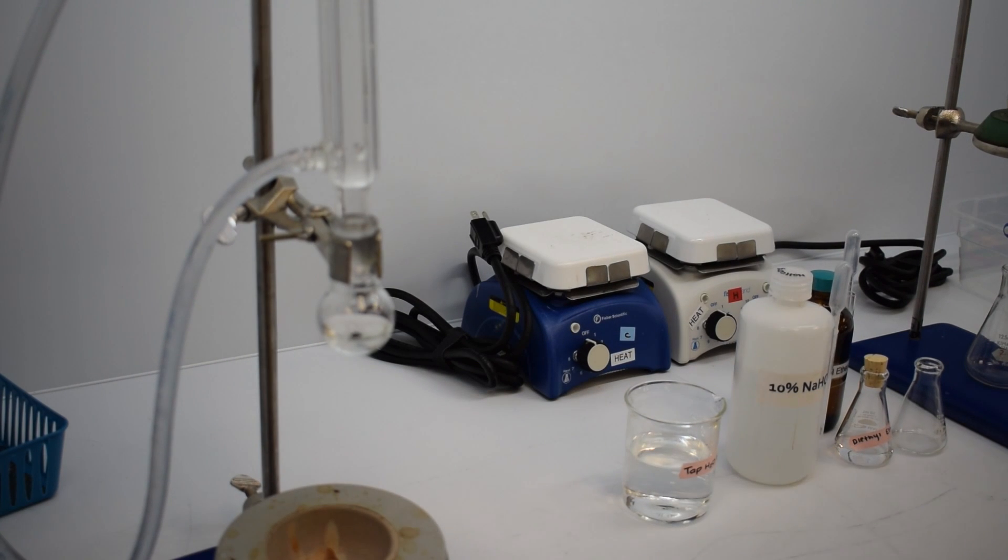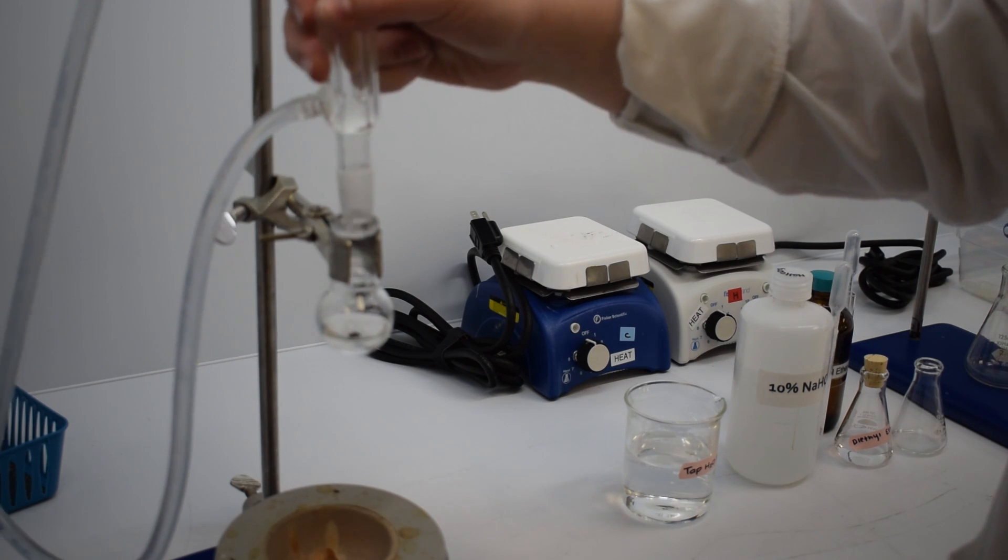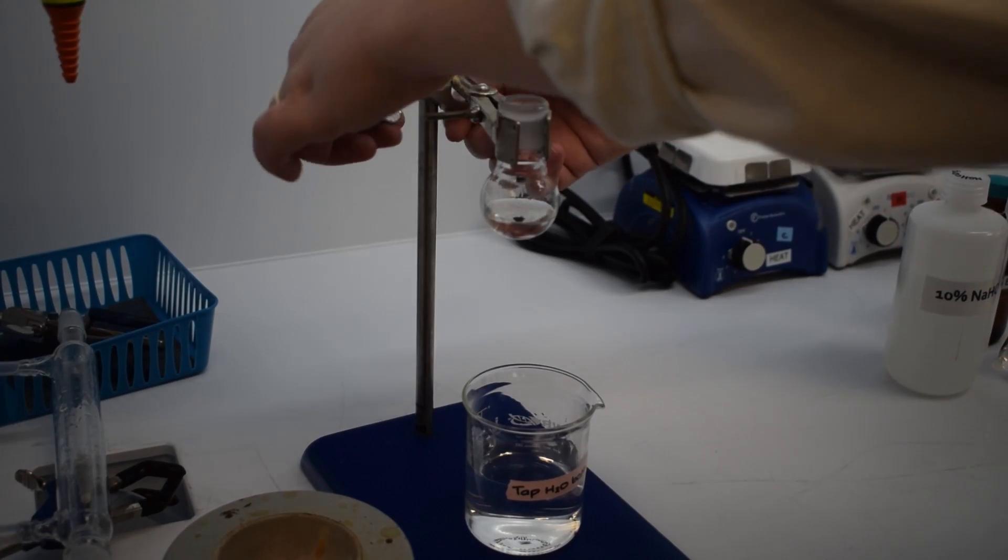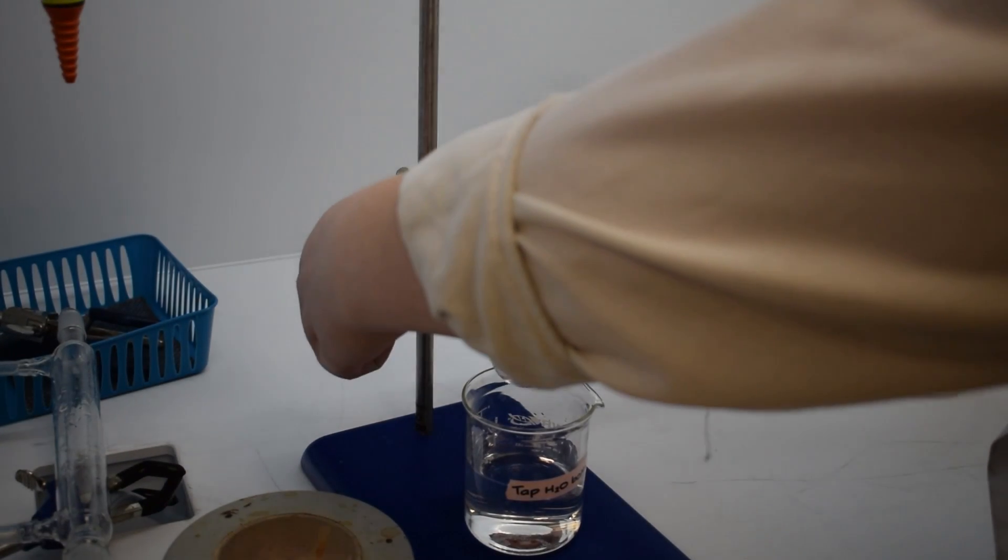Now that it has refluxed for 30 minutes, our reaction is complete. The heating mantle and condenser have both been removed from the round bottom flask and it will be lowered into a tap water bath. This will allow our reaction mixture to cool to room temperature.